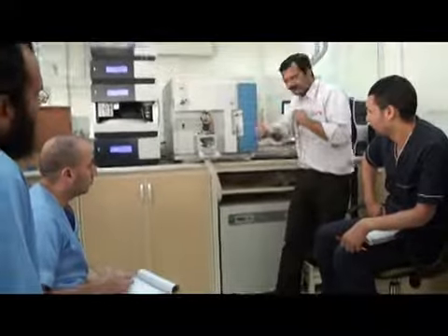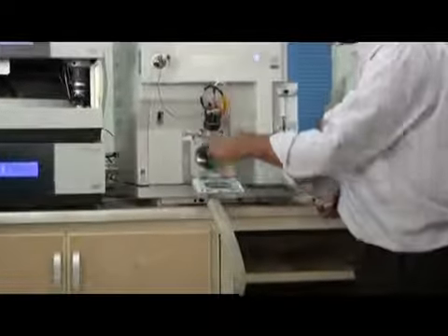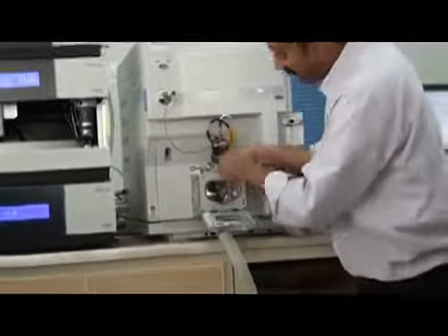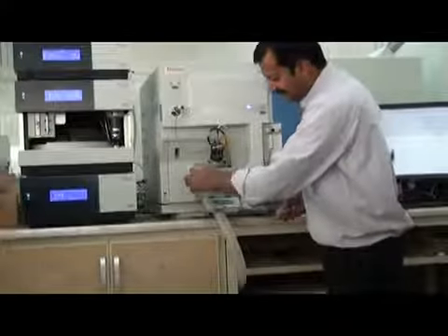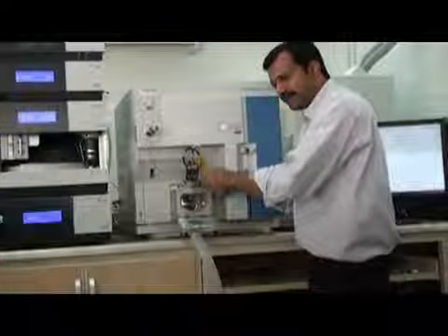Okay, it will take it. This is the technique here. We have a position, we can move this here, we can move this like this, and we have one more position, we can move it like this. This has three positions. This one, and this one. This one is like this. Okay? We can move it and we can fix it.